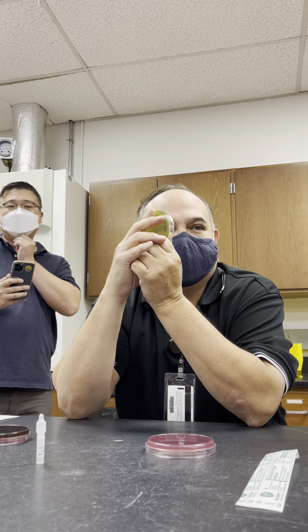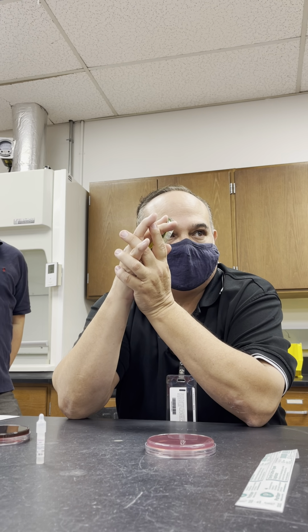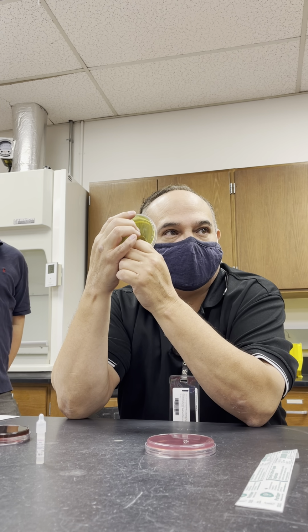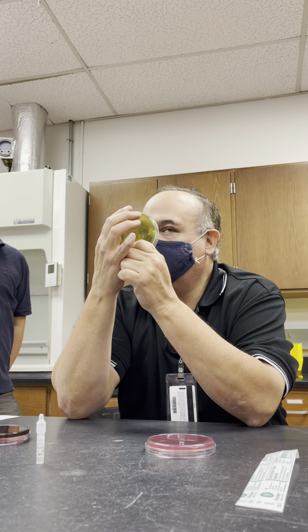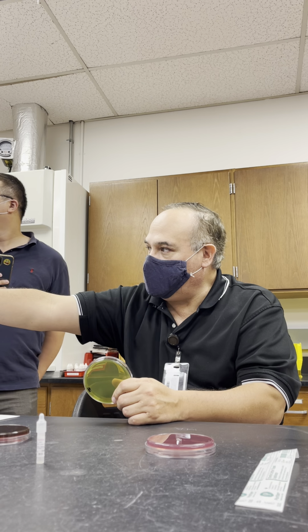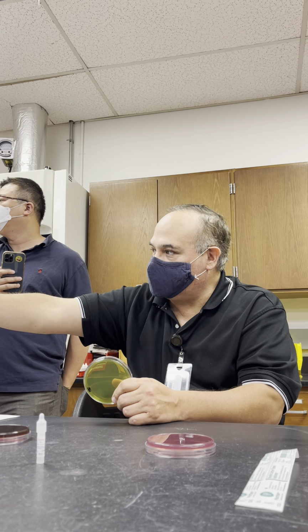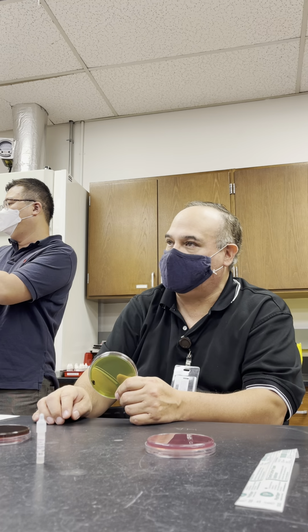So if the organism shows up as yellow or orange on here, it's a fermenter, and we don't care about it. It's not a pathogen in the GI tract. But if it's a non-fermenter, that means it doesn't have a color to it, or if it's a non-fermenter that produces hydrogen sulfide, then we worry. So you can see right over here, I put down that we worry if it's a colorless colony because it's a lactose non-fermenter, and it could be Shigella. Or if it's a colorless colony with black precipitate, we worry because it could be Salmonella.